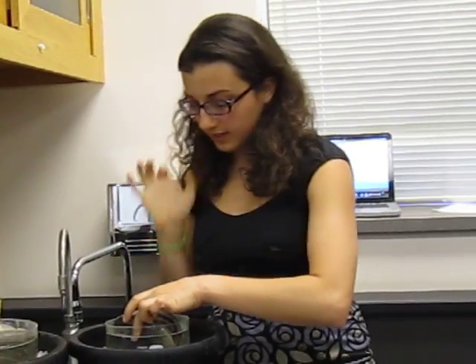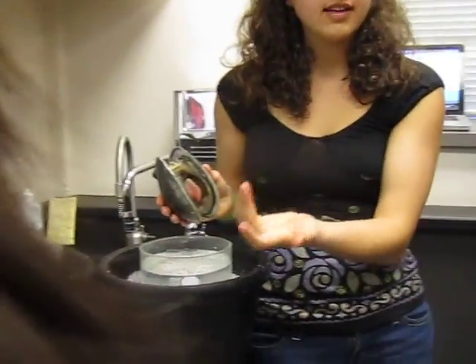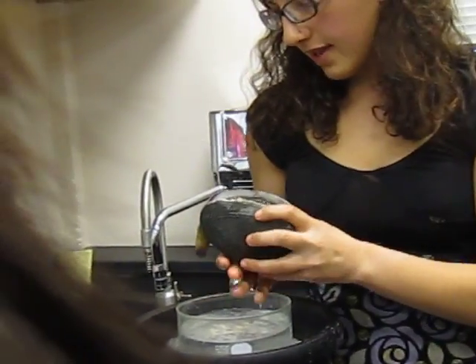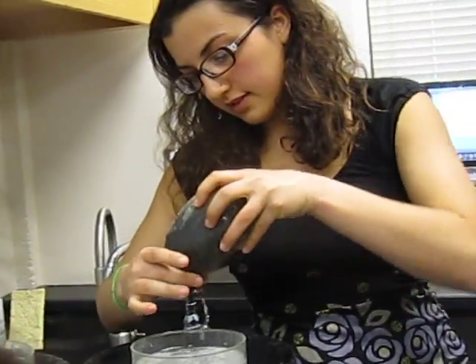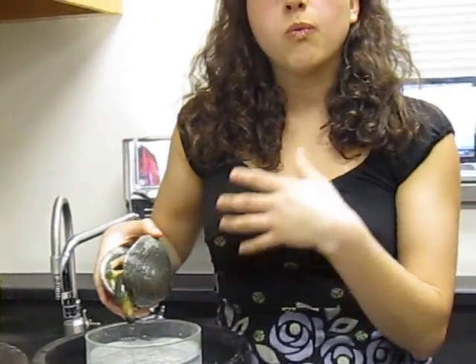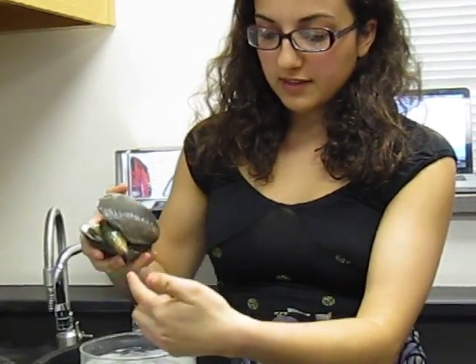So now let's start going into the internal morphology of the clam. So we've got mantles right here. You guys can come closer so you can see this stuff better. This is the mantle, one of the features that is common to mollusks. And this is the siphon, tubey thing right here. Knowing what side is ventral and what side is dorsal can be really helpful in telling us which of these two little openings is the excurrent siphon and which is the incurrent siphon.